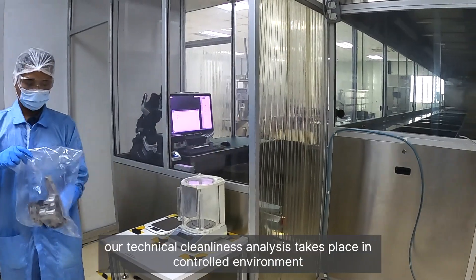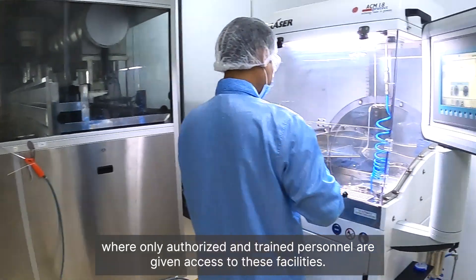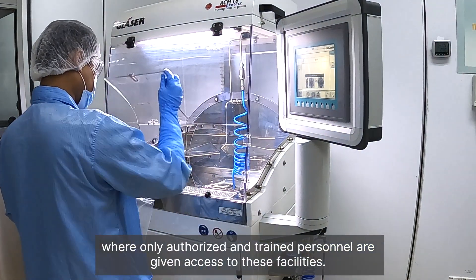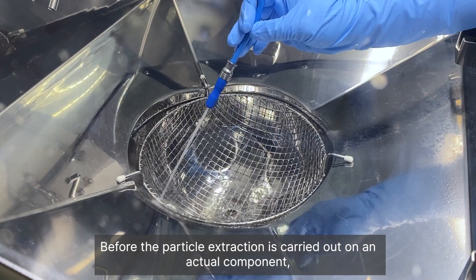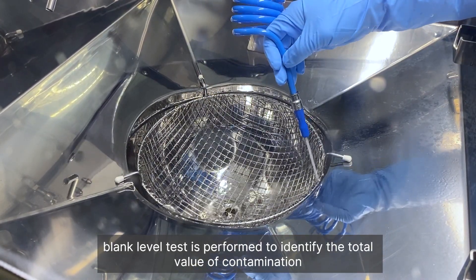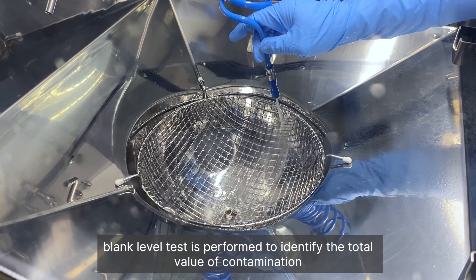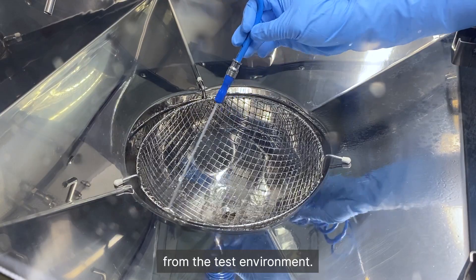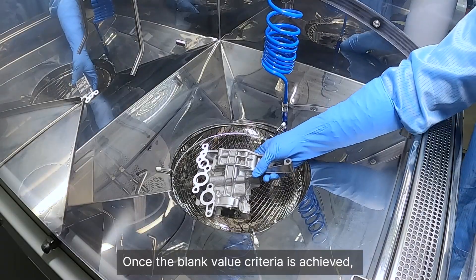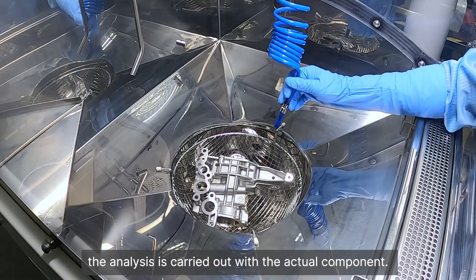Over here, our technical cleanliness analysis takes place in a controlled environment where only authorised and trained personnel are given access to these facilities. Before particle extraction is carried out on an actual component, a blank level test is performed to identify the total value of contamination from the test environment. Once the blank value criteria is achieved, the analysis is carried out with the actual component.